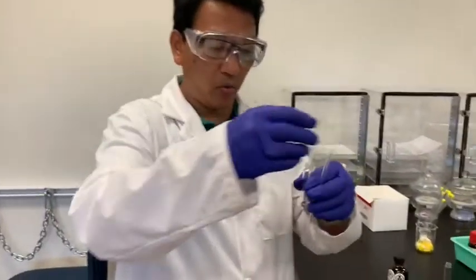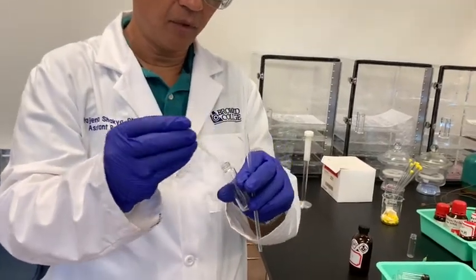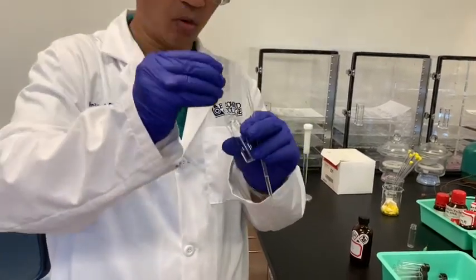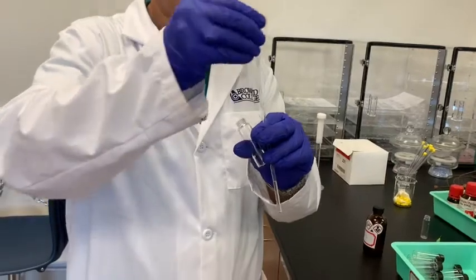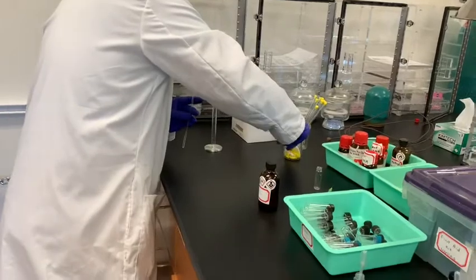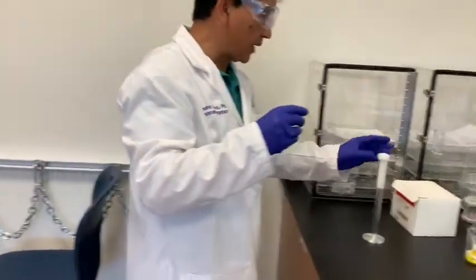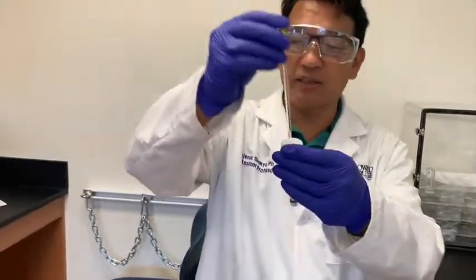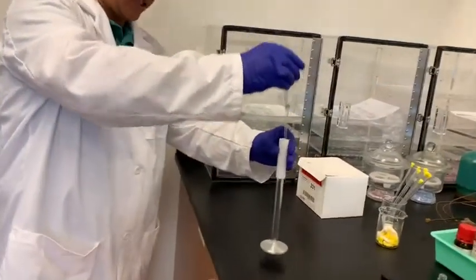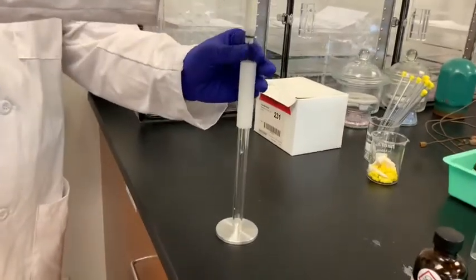I want to use this NMR tube. This is where I wanted to load my sample solution, and yeah, that is more than enough. So whatever is here, just add that. Now I wanted to use the cap to close the mouth of this. So here, now I need to make the measurements for the height here. So I just load it here and just make the measurement here. Okay, you can push it a little more here, so that is good. So this is a good height here.